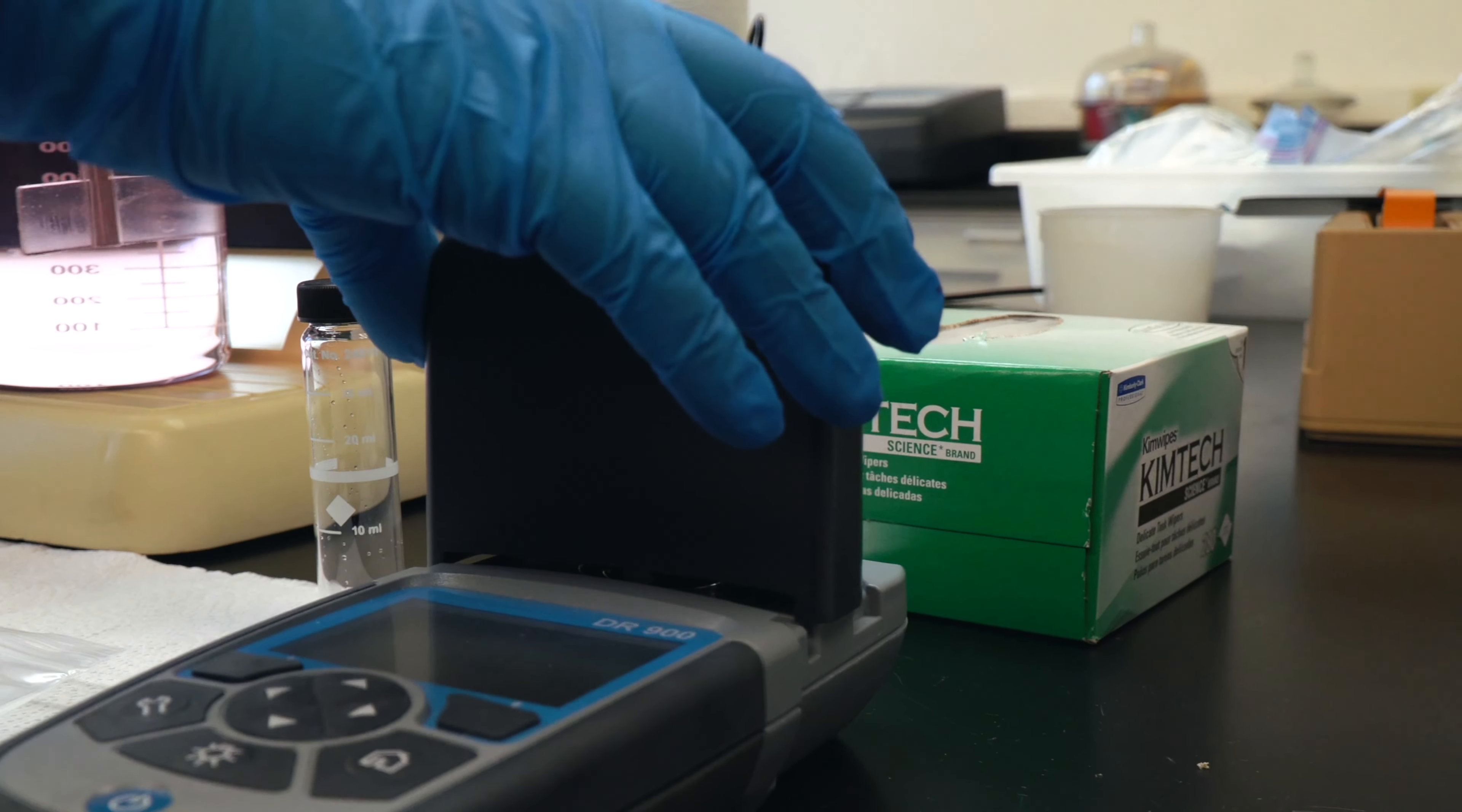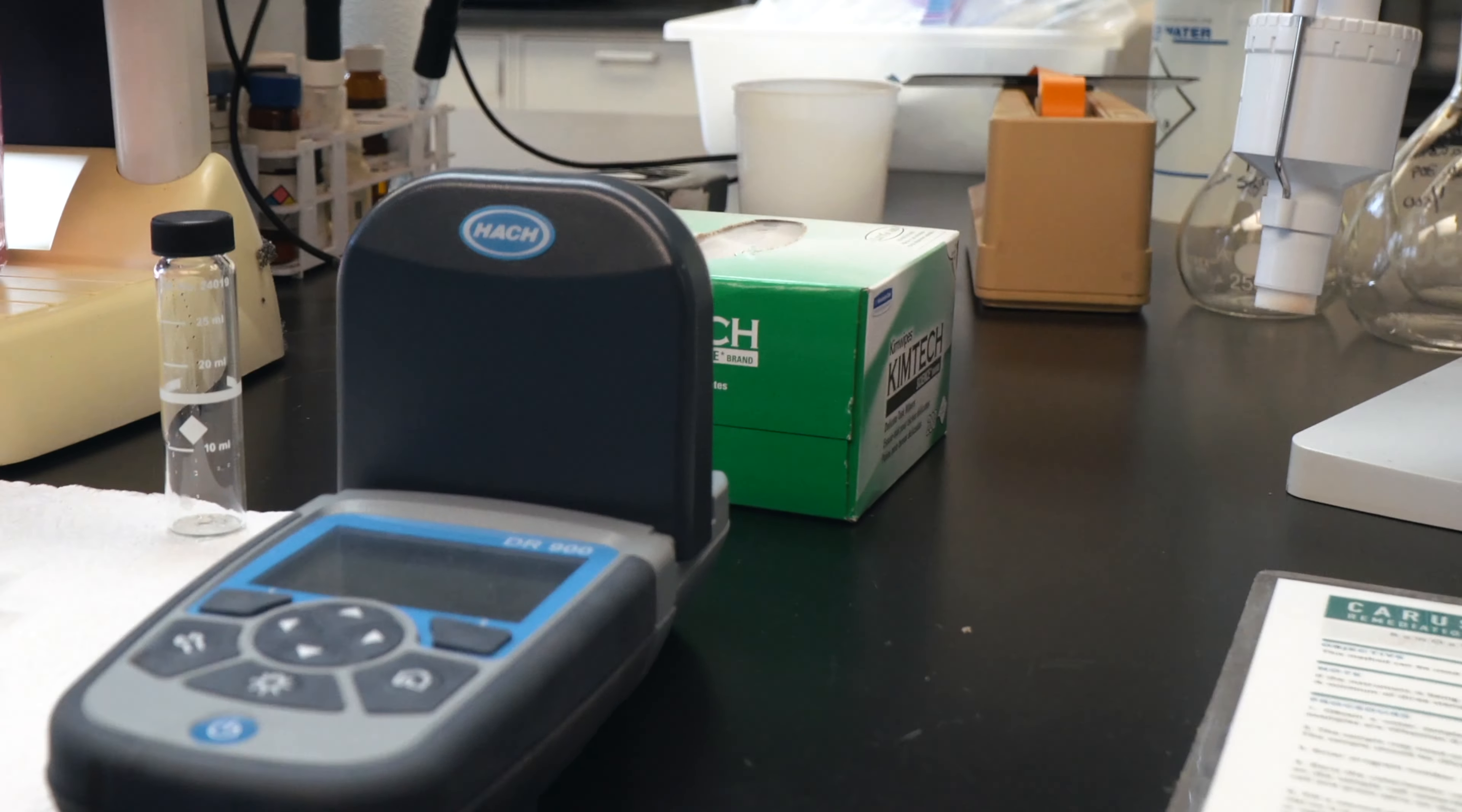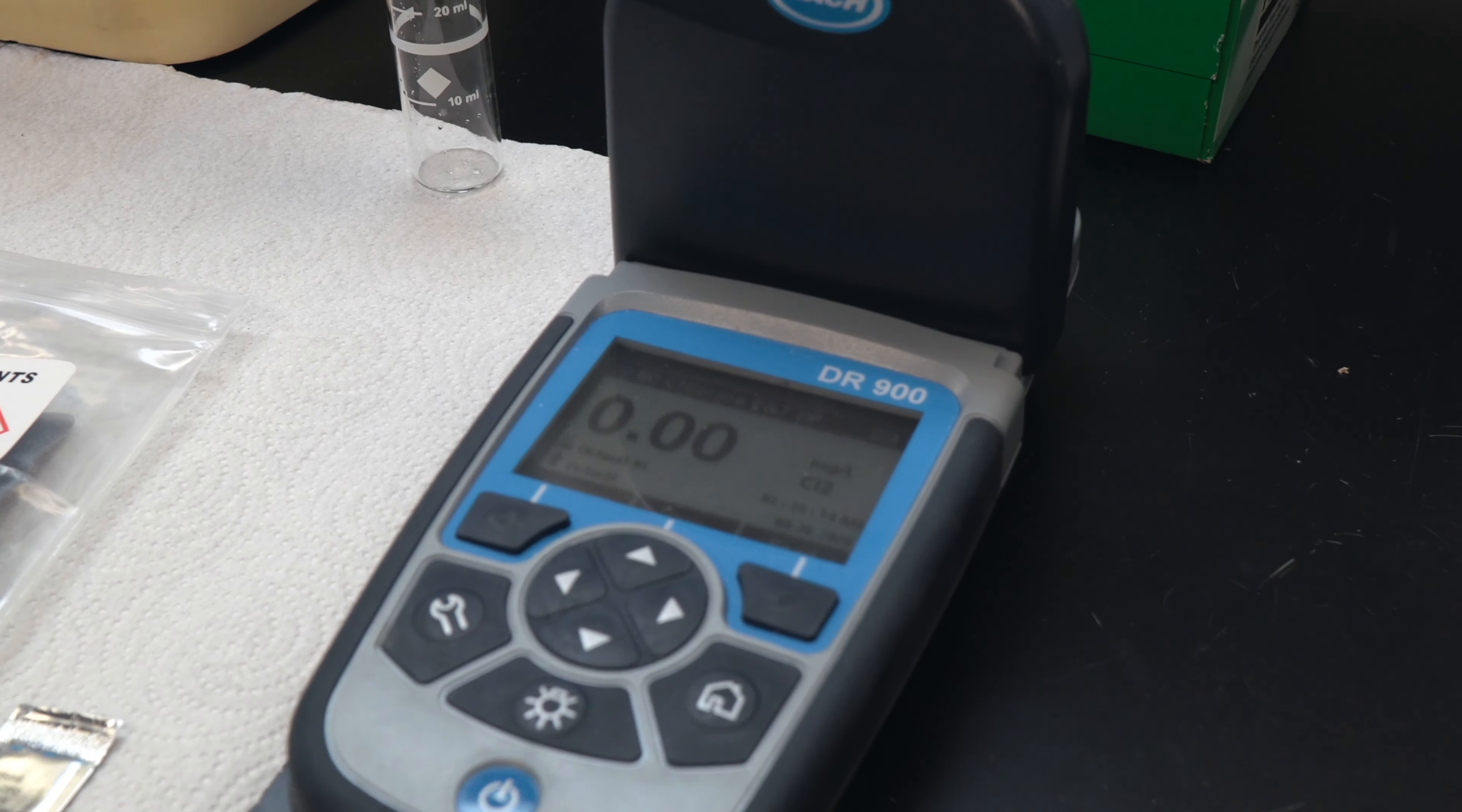To zero the spectrophotometer, grab a sample of raw water and filter it. Use this raw water filtered sample to zero the spectrophotometer.